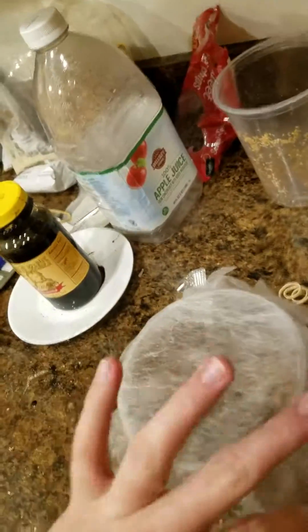Generally I'll do this splitting several times if the containers are loaded with maggots enough. Since these guys are pretty much fully grown, I probably don't have to do that again.